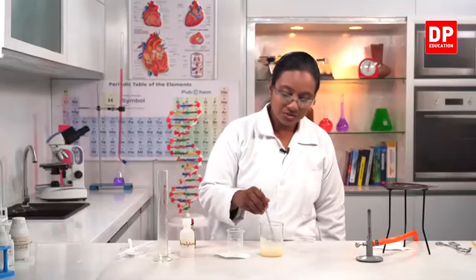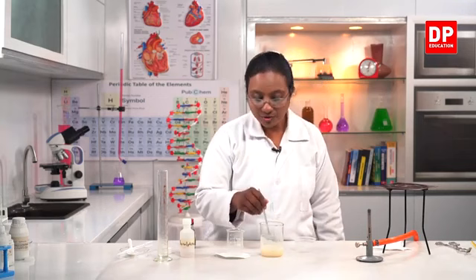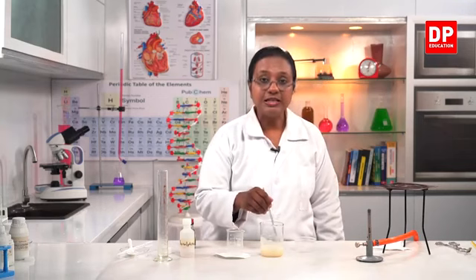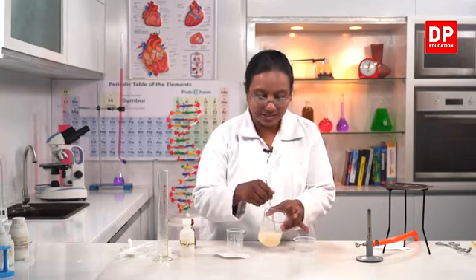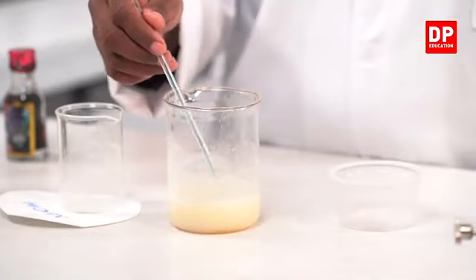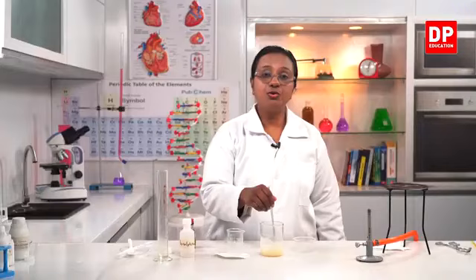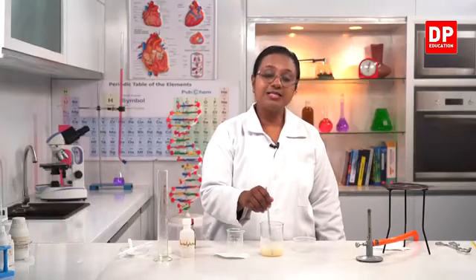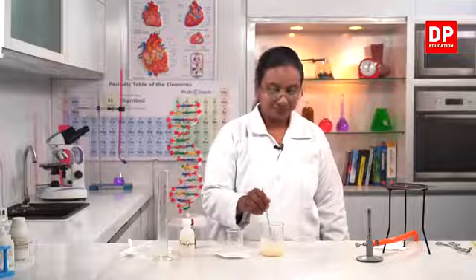So here students, you can see I have been mixing it for about 10 minutes. So now you can see then from earlier, the mixture has become paste-like. You can observe that clearly here. It's a pasty-like nature. That's because the coconut oil is reacting with sodium hydroxide and the soap is forming. Like this, I have to keep on mixing for another 10 minutes.